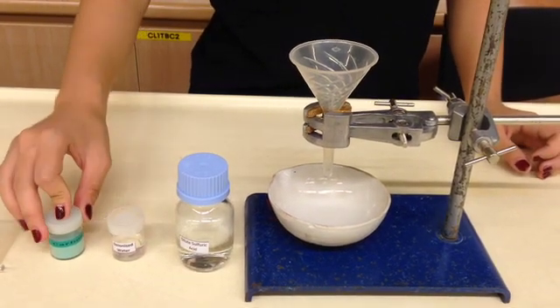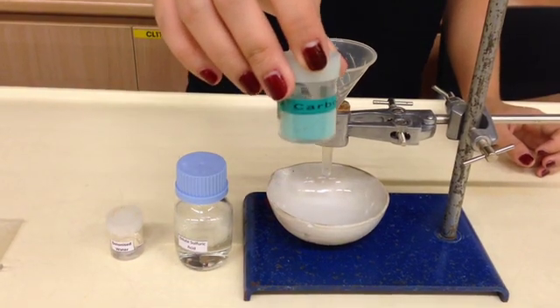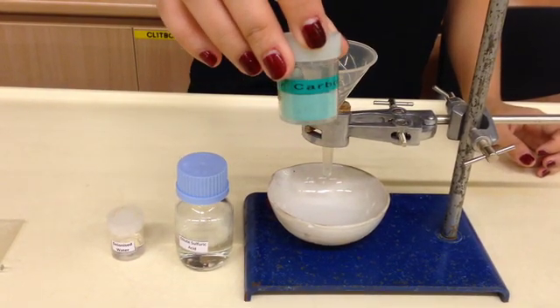Similarly, because we need copper 2 ion, the copper 2 ion will actually come from this insoluble reactant, which is copper 2 carbonate, which is a green color powder.